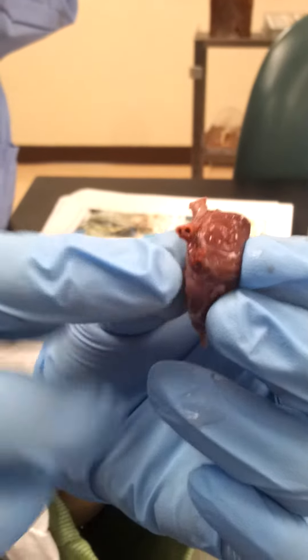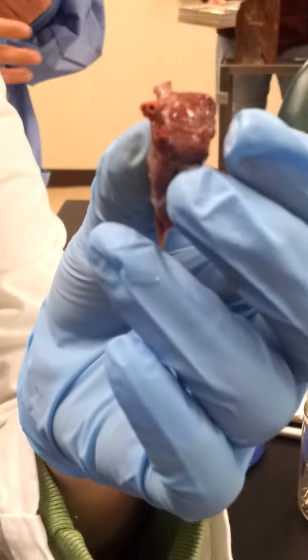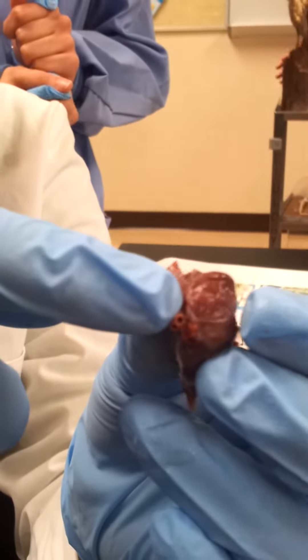Both of the two. One connects the posterior, one connects the anterior, and they come in together here. I see. And they go through the heart, and they go out.